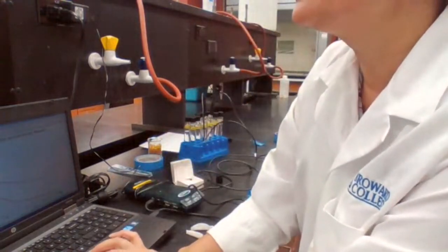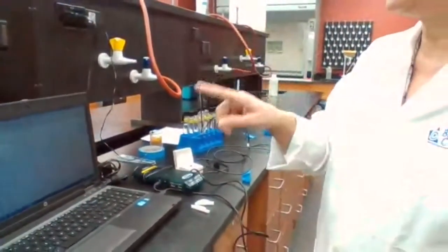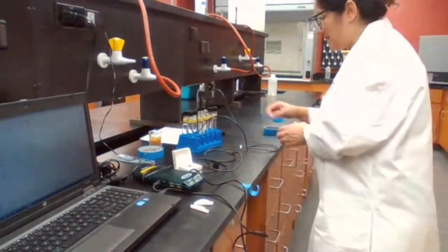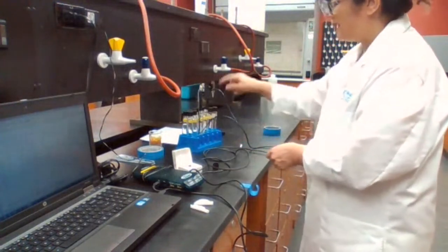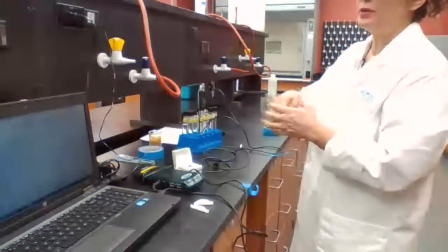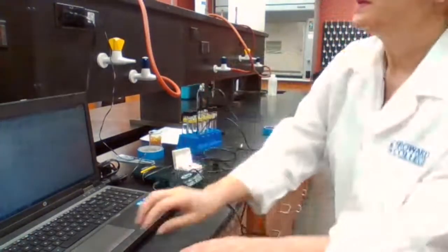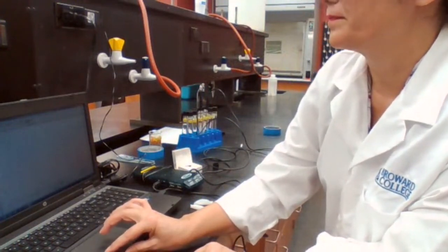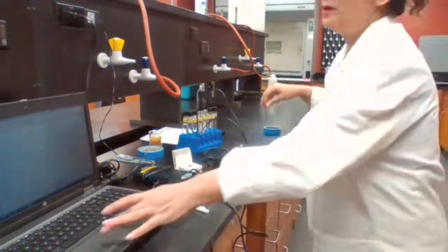For 45 seconds we place in the solution. Following the procedure, then I'm going to start collecting. As soon as I start collecting, I take out and place the thermometers. Channel one on the left side, channel two on the right side, so I know channel one is going for propanol or the red color. Start collecting. 23.1, 23.1 for both.